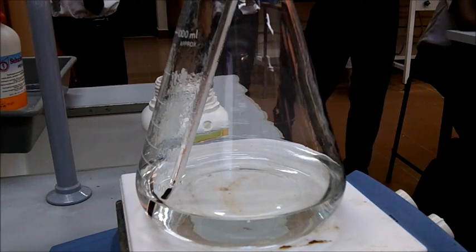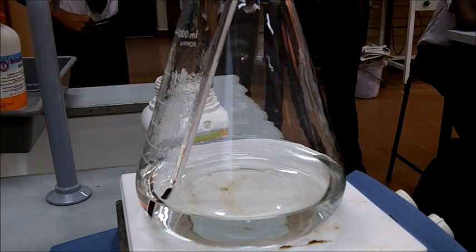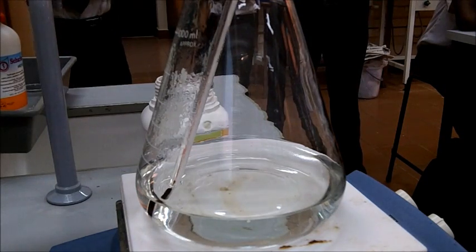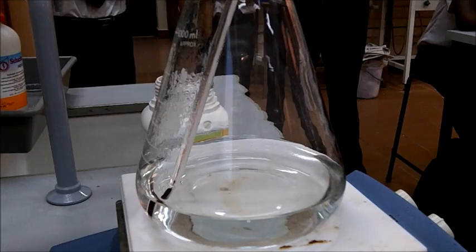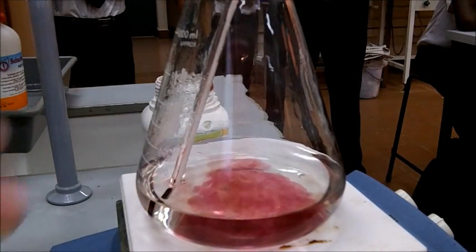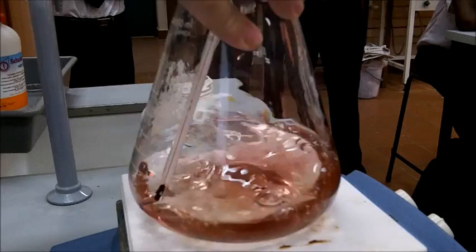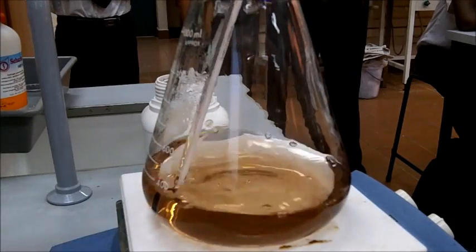Okay, so those two have combined. It's just like the peroxide sat over there. Without the catalyst, not a lot happens. With the catalyst... Yeah, well, what else? Still nothing. I'll give that bit of a swirl.